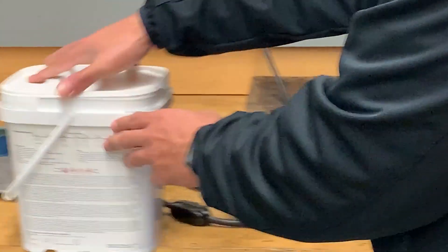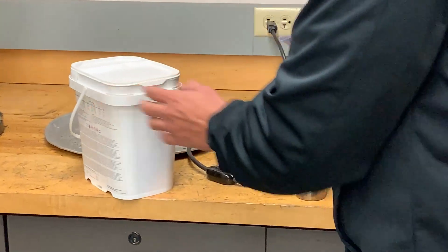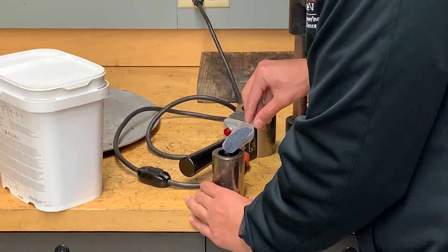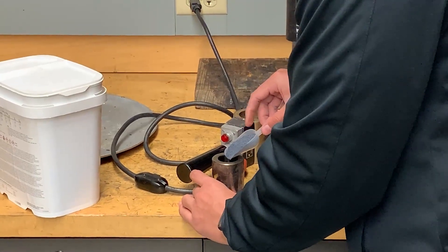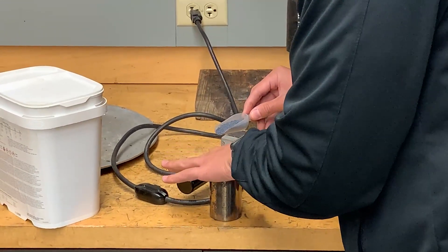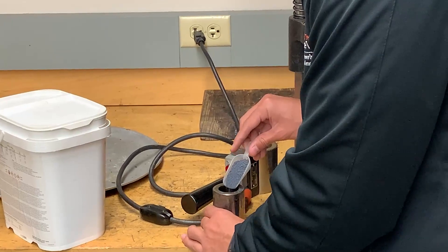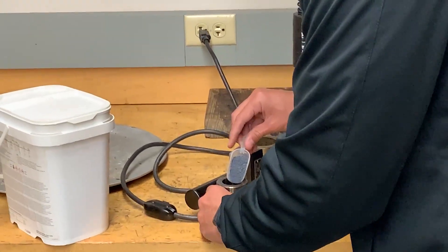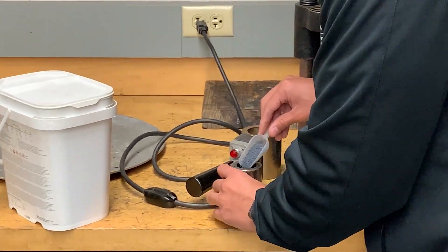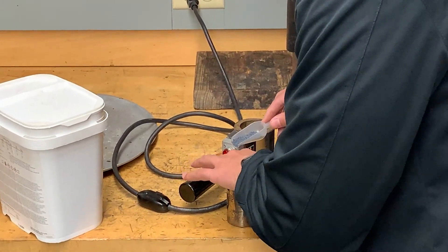We're going to grab either a couple scoops or just one scoop of the polymer resin. What you want to do is fill it up to where you cover your samples — just enough to cover them. We don't want to go too heavy on this material, but just enough to cover initially. I just covered the top of them, and I'm going to add just a little bit more in an even coat all the way around so there's enough material to prevent fracturing the puck or mold when the samples slide out. Just enough to initially cover and then just a little bit more.